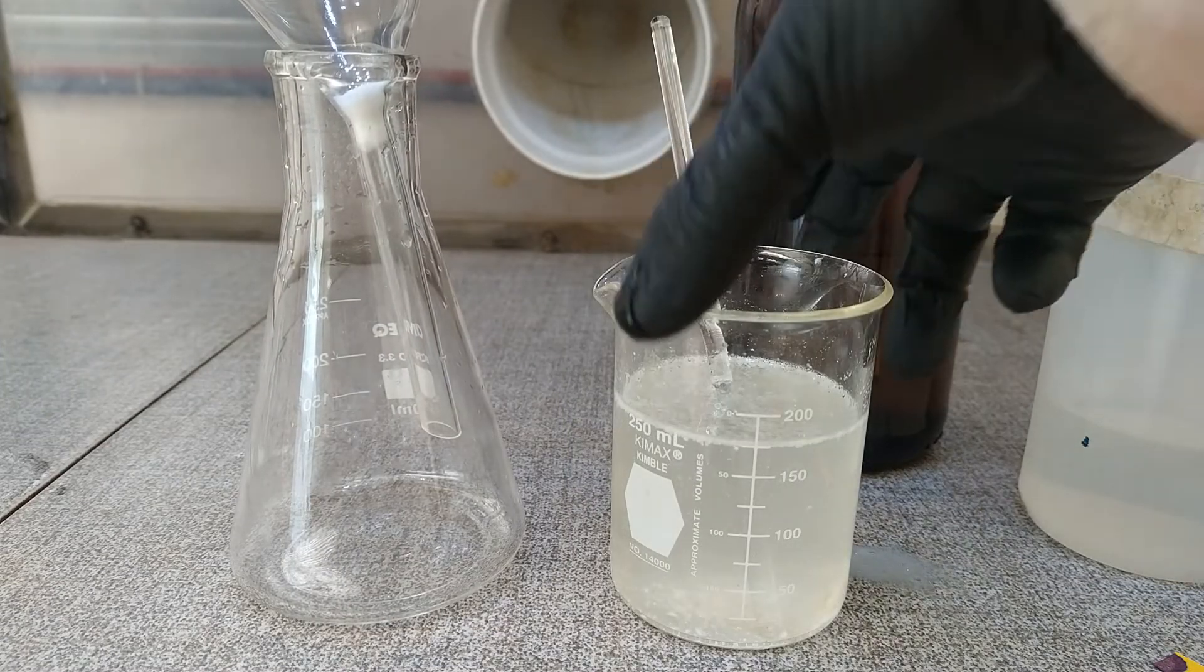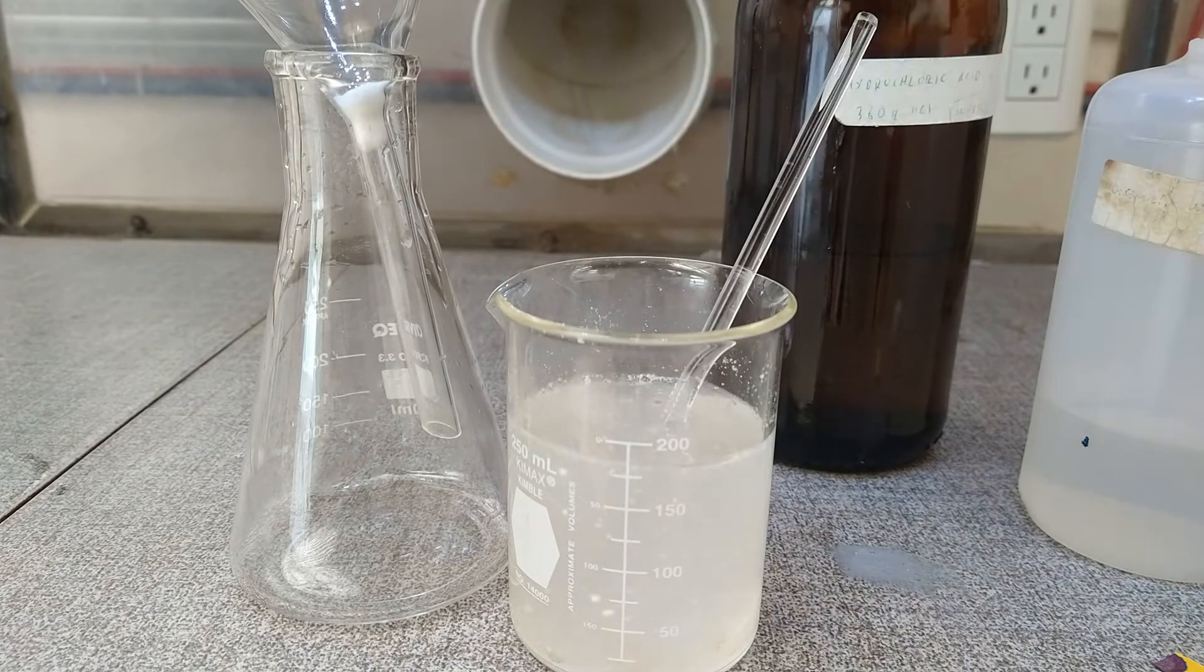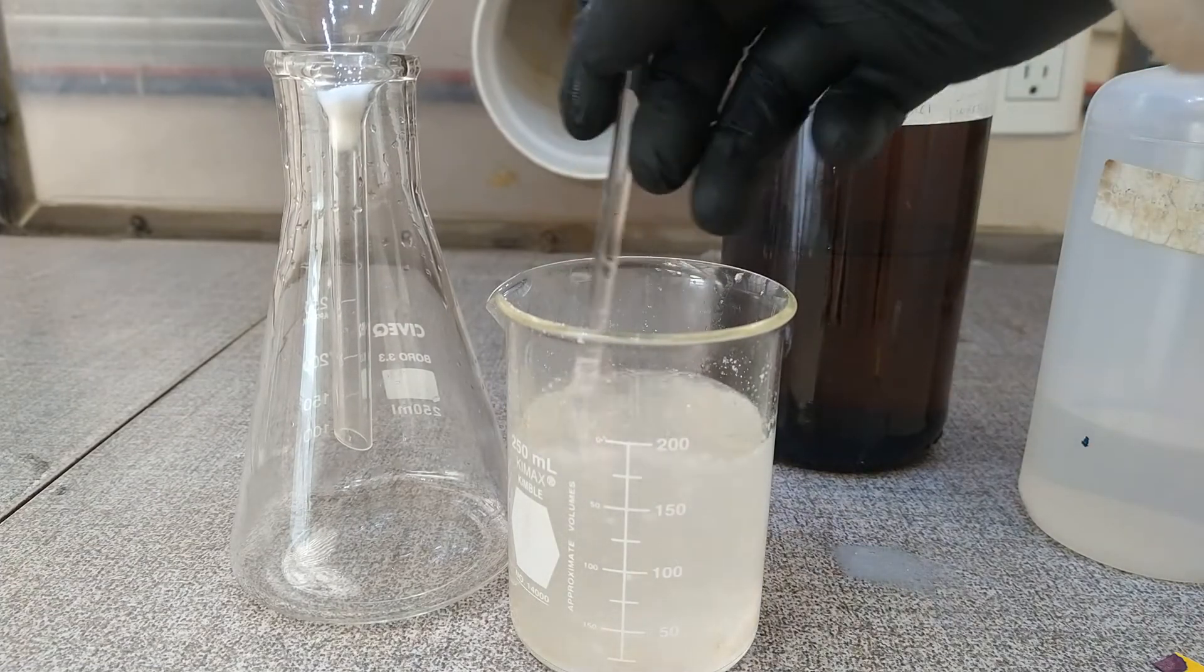Now as you can see our crude product is somewhat dirty. So we have to filtrate it first through some cotton filter to remove some impurities.